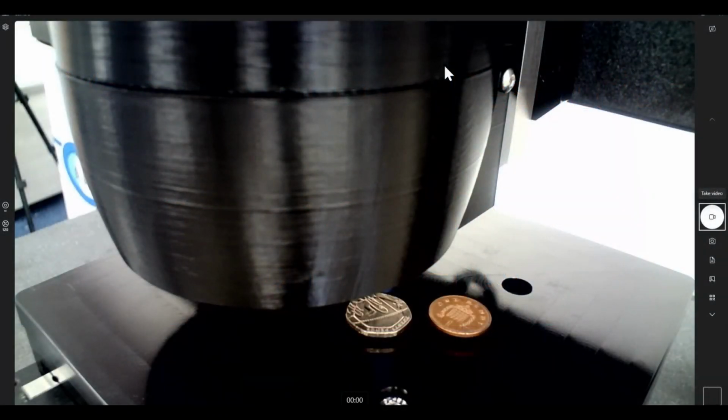In this video on the XYRIS instrument, we're going to look at the ability of the instrument to measure multiple components within the measurement plane. And the measurement plane is this large black area. And we're also going to look at the ability to control the resolution of the data we collect from the images. So those are the two key things that we're going to look at.